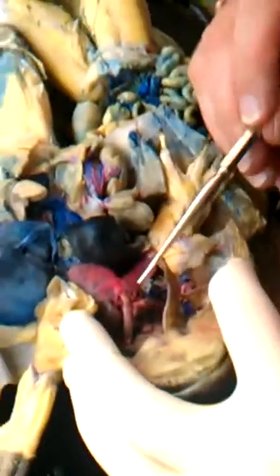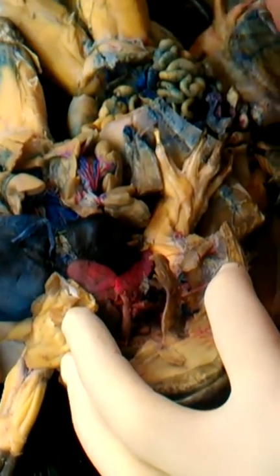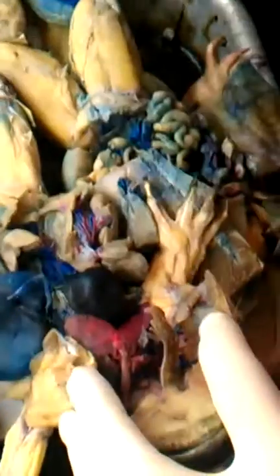is conus arteriosus, and that's actually a heart chamber. It has cardiac muscle. And it splits and forks into a Y. Each of these are truncus arteriosus, and then from there the blood vessels are the same on the frog's right and left side. Now, it looks like this left side's a bit easier to see, so we're going to look at it for this frog on the left side.